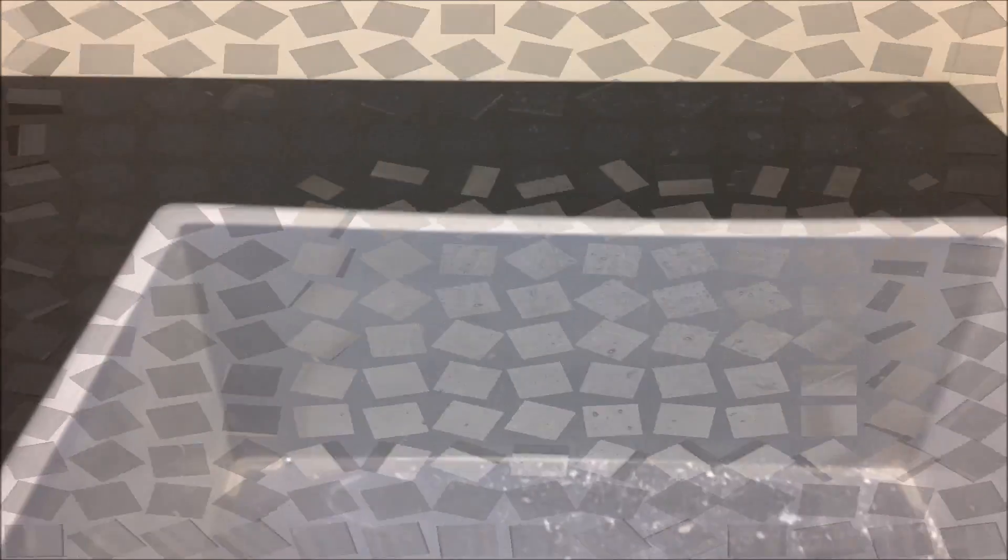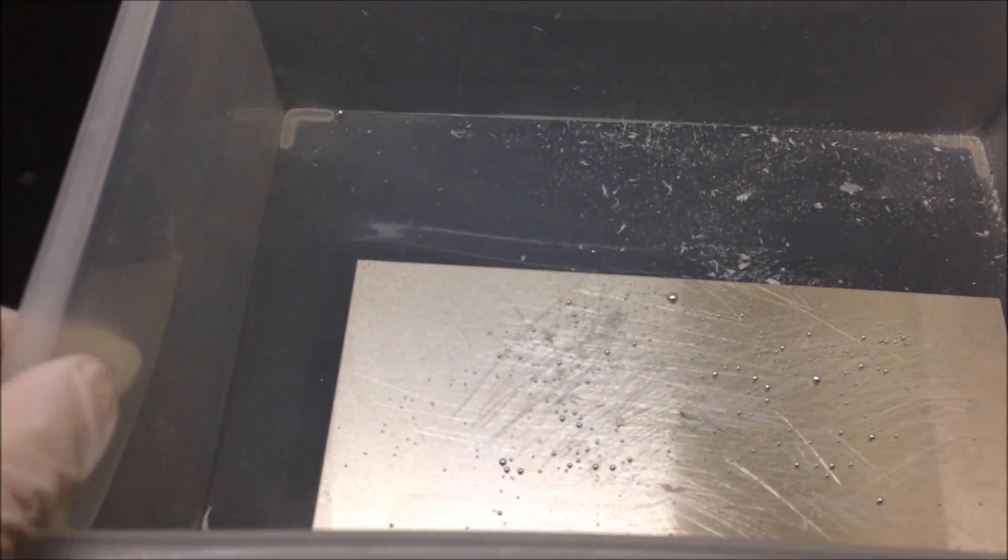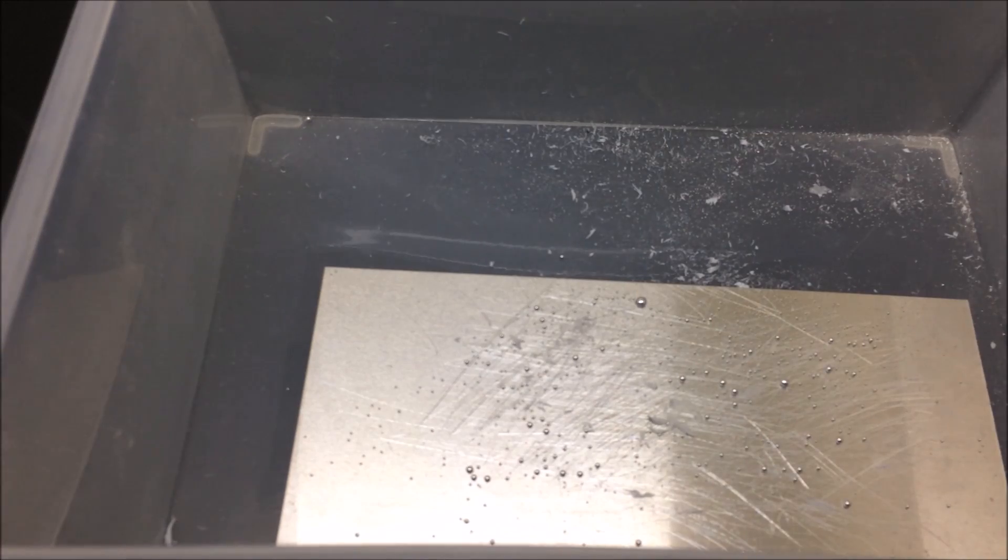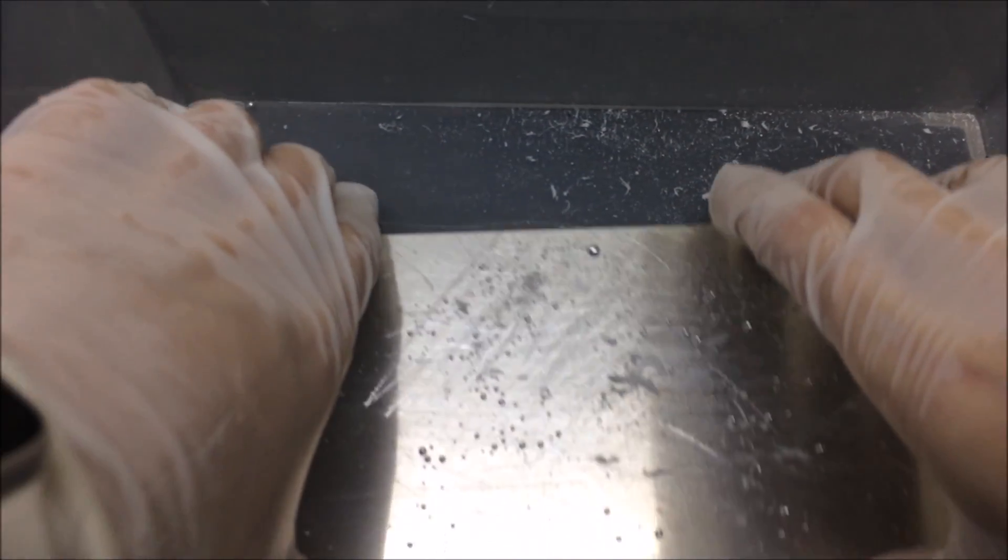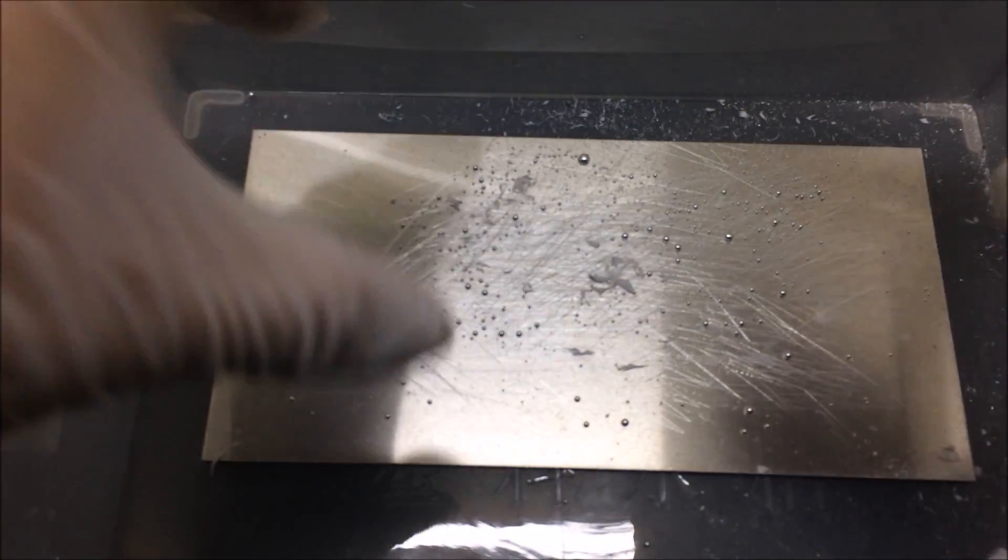And here we go 2 days later. You don't see any lovely mold here because I had to leave this outside as my fume hood was occupied for other projects, and it was a bit windy outside. But anyway.